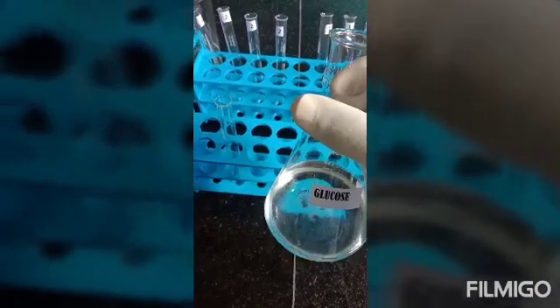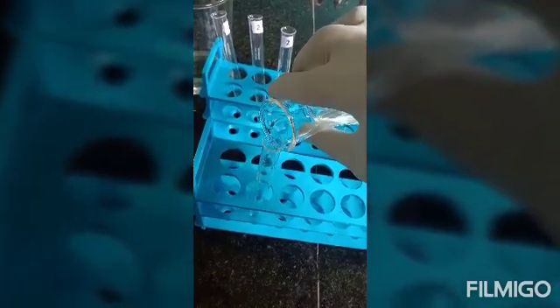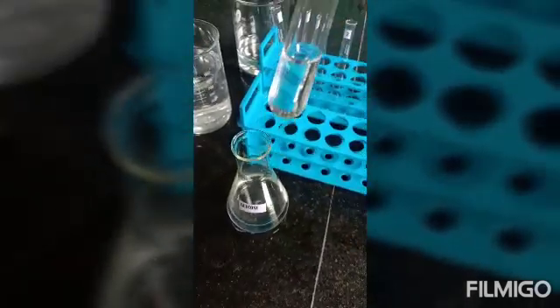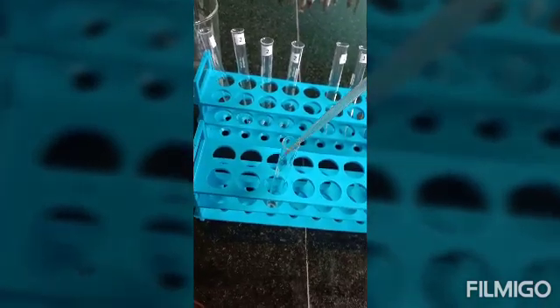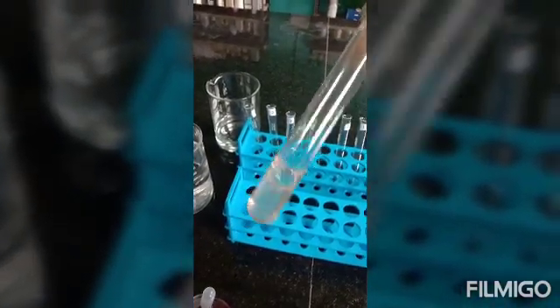Approximately 2 ml of 1% glucose solution is added to a test tube. To this, 2-3 drops of Molisch reagent are added and shaken very well.